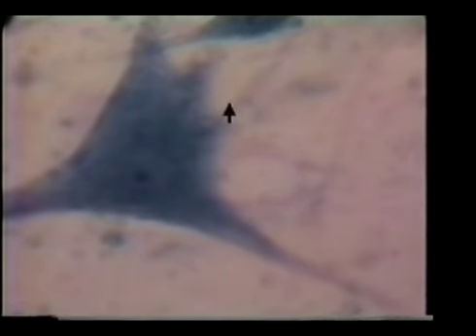High power, we can see the cell body better. Again, all of this blue area is the cell body. And we can see inside the cell body, we can see this nucleus located right here. Again, all of the little specks, the little dots that we see out in here are neuroglial cells. Here we have a couple, 3 cell bodies. There's a good couple of cell bodies there with the nucleus right in the middle.